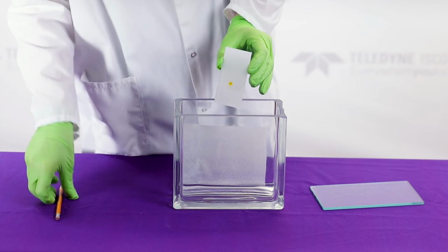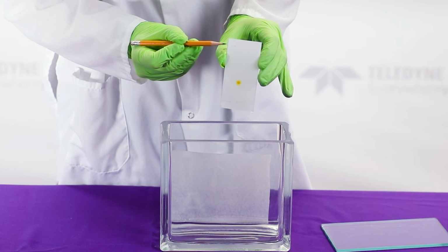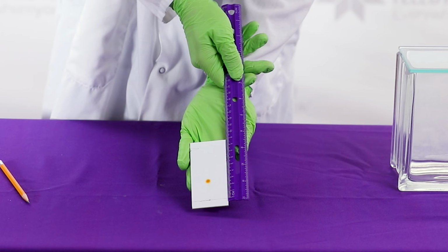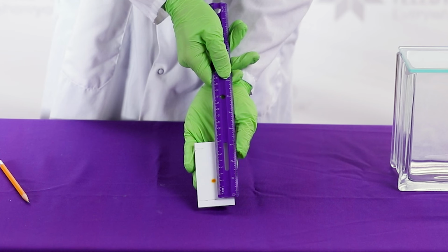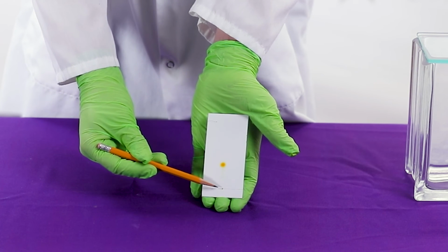The solvent front represents how far the solvent traveled up the glass plate, starting from where we placed our compound. You can find the solvent front by noticing where the silica gel transitions into a darker color here at the top. We can then measure the distance of the solvent front by measuring the distance between our original center point and our new marking. We should also measure the distance our sample traveled up the glass plate by measuring the distance from our original center point to the center of the dye's highest spot here.